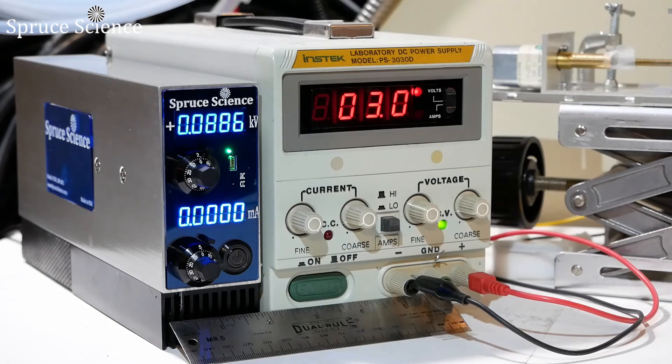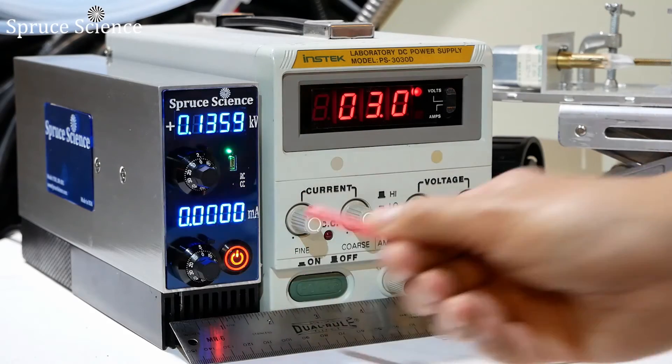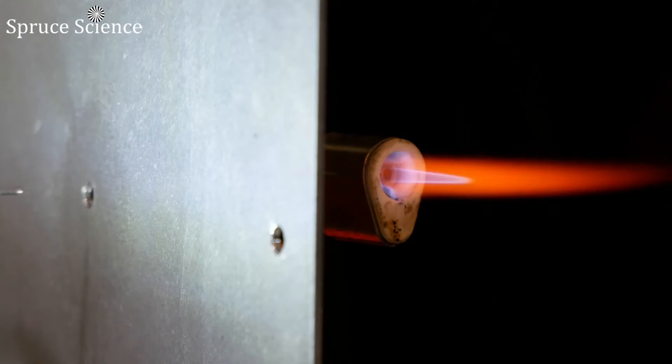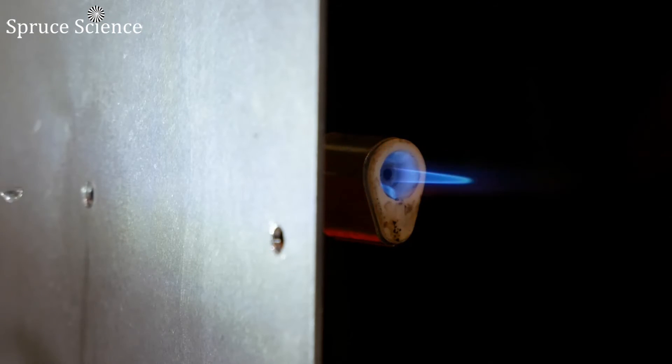So far in this demonstration, I used the enable button on the high voltage power supply to toggle between 0 and positive 6 kilovolts to show the abrupt response. However, it would be interesting to see the gradual response.